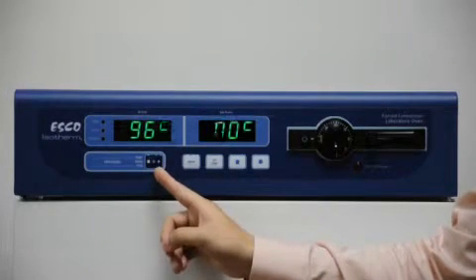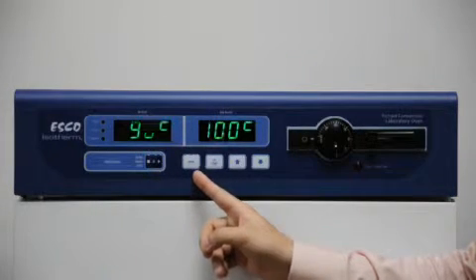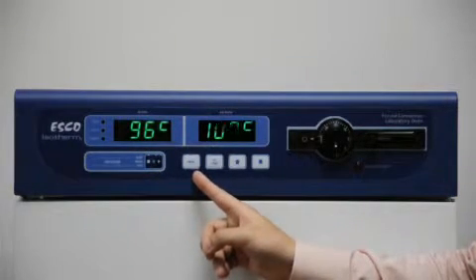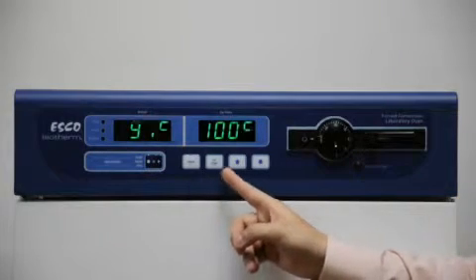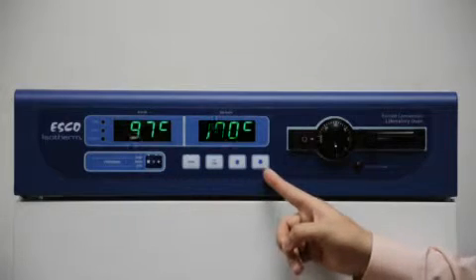You can start, pause, stop programs. Menu key for entering the menu for data logging, alarms, and other advanced settings. Set temperature, up, down keys.